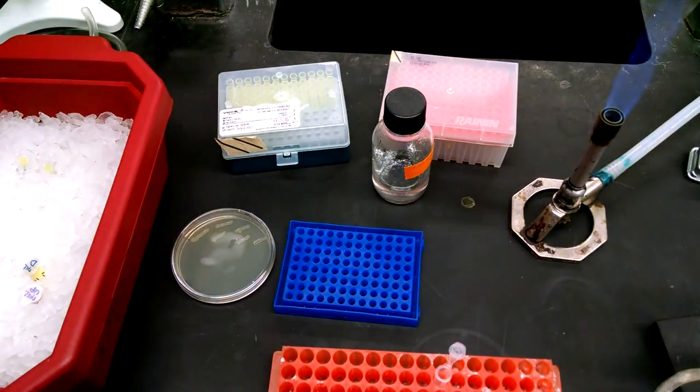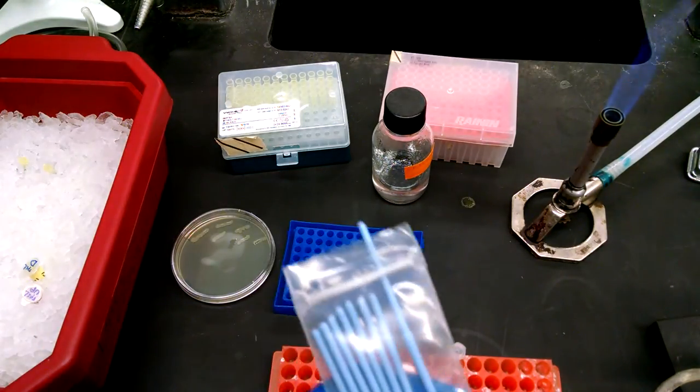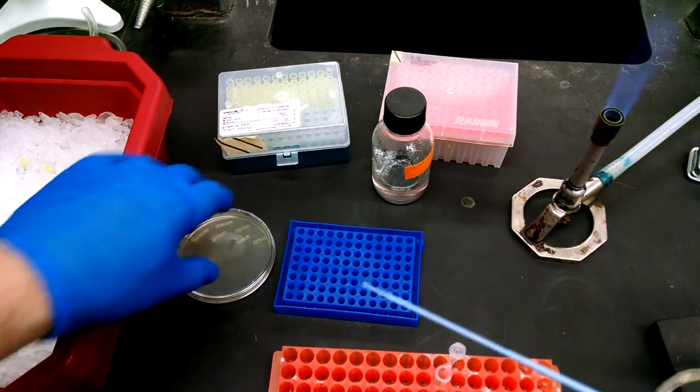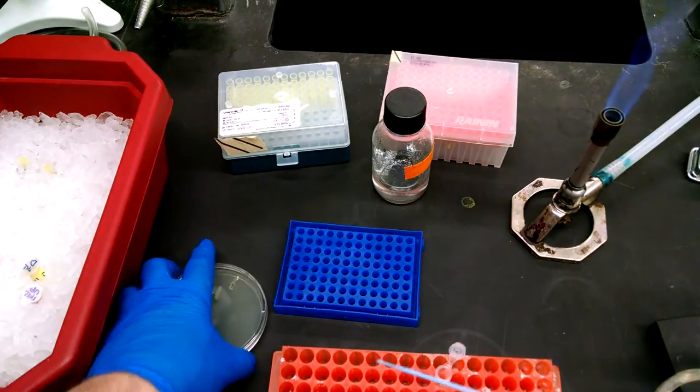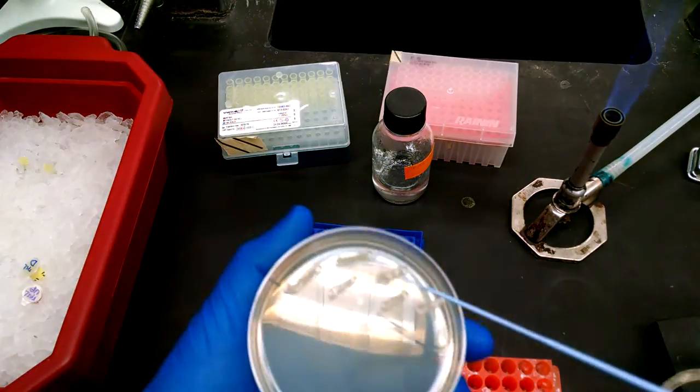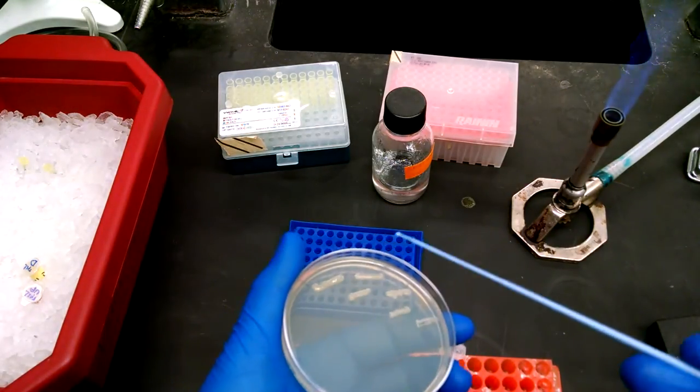We're going to use some loops, but we have some special loops, some small blue ones, very small loops that can reach down in there. You don't want to use the other ones. They're too big.